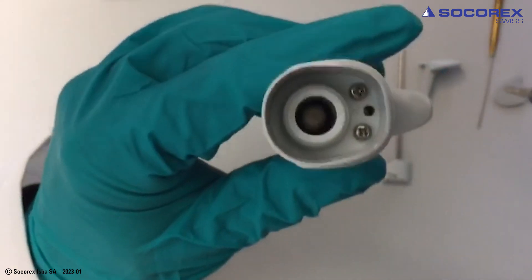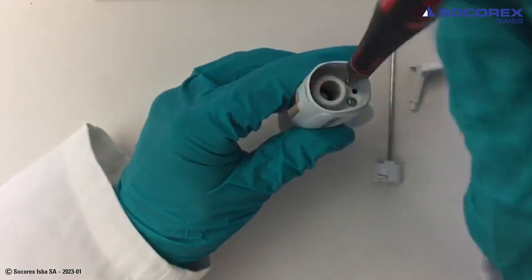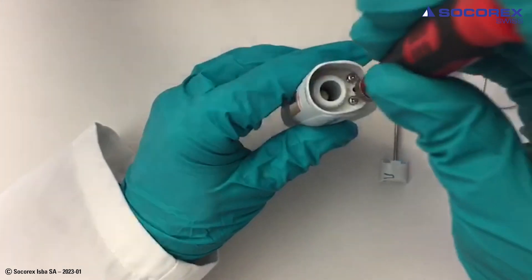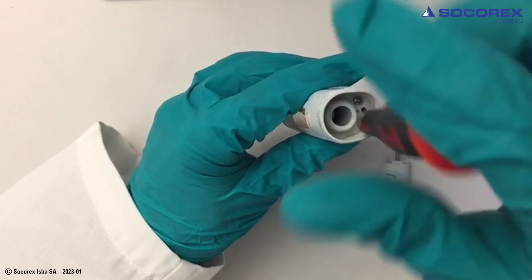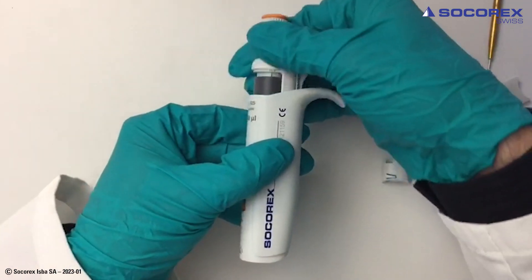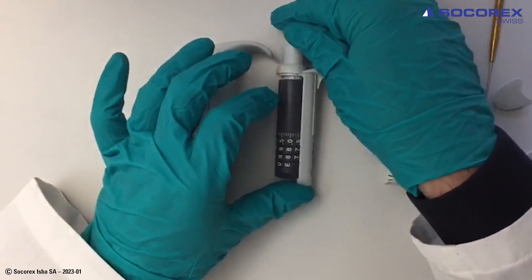Then remove both the screws. Then remove the entire counter assembly.